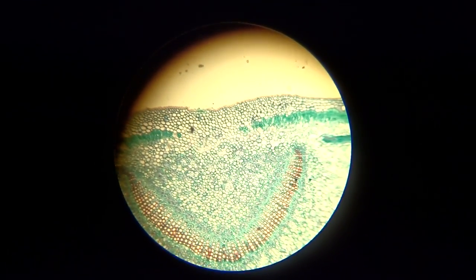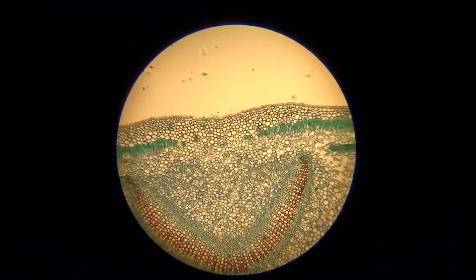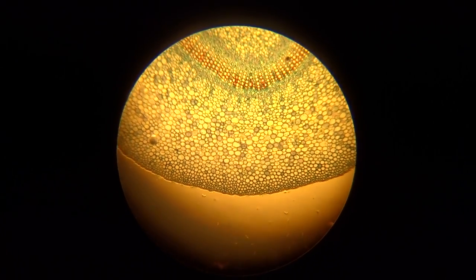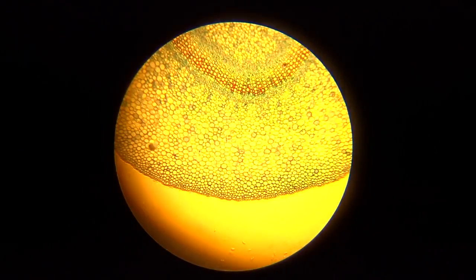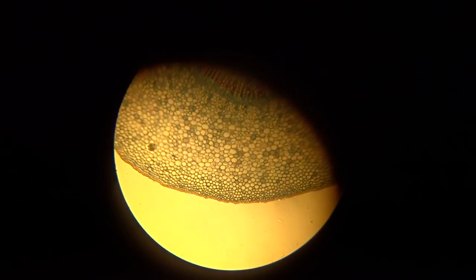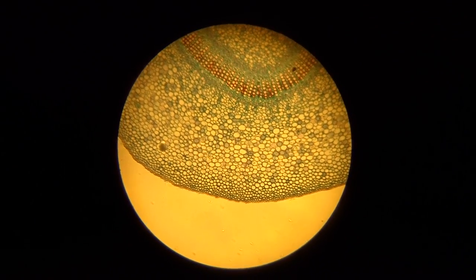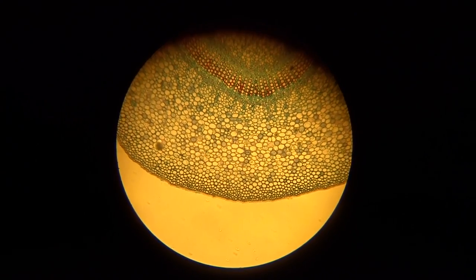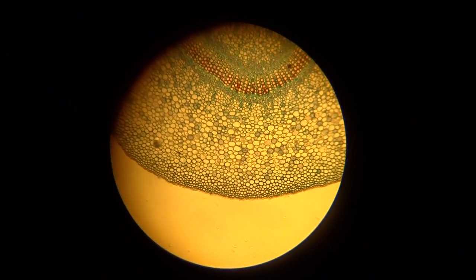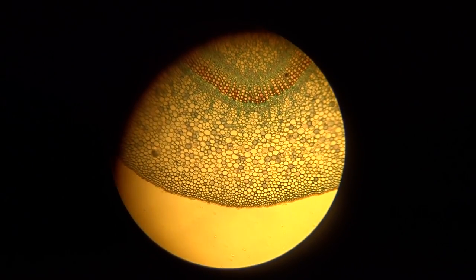Now we're under low power or 100 times magnification. This is the cross-section of the leaf, and you can make out the different regions of the leaf. Once I get it focused, at 6 o'clock you have the waxy cuticle. Then the cellular layer behind that is the lower epidermis. And then we enter into the spongy mesophyll.